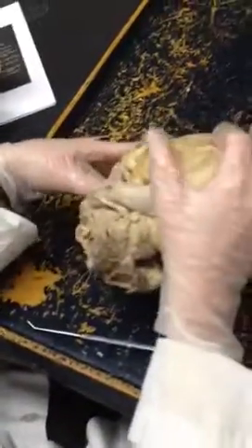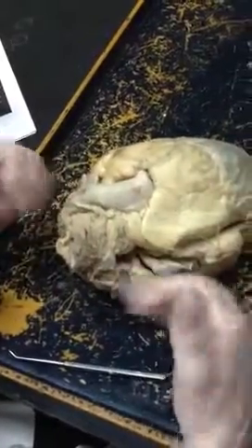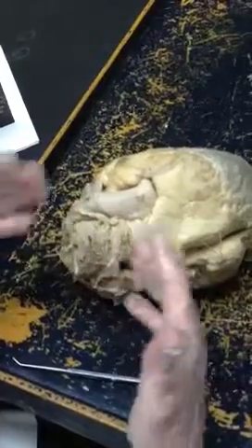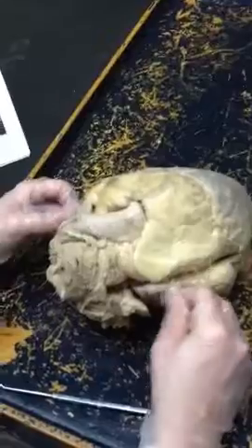Like the ear flaps — so these are the auricles. If you want to put auricle down, that's fine, but auricle is usually just referring to the outside of it rather than the inside. So it's still the atrium, but it's a special name. Just remember those dog ears — that's what they are.